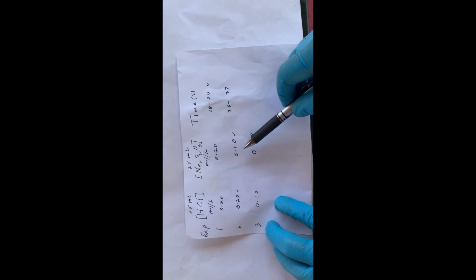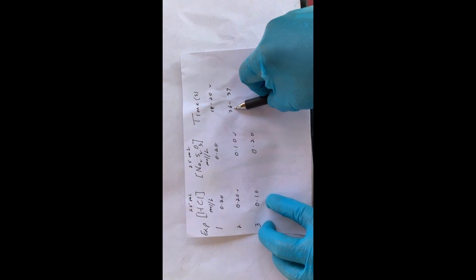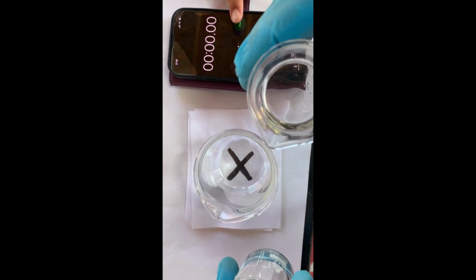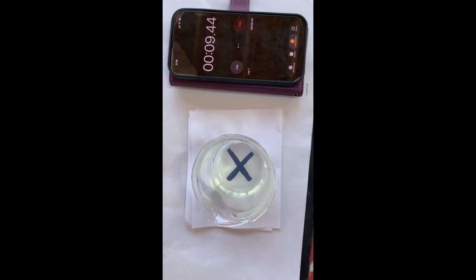In this case, we reduce the concentration by half, and we got that time for the X to disappear. What do you think will happen now that we're reducing the concentration of the hydrochloric acid by half, and we are keeping that concentration of the sodium thiosulphate? Make your hypothesis. If you follow the trend, you might want to say that it should take that time there. So to verify that, we'll do the third experiment. So here we go, the third experiment. Stop it. Okay. Let's see how long it takes for the X to disappear.